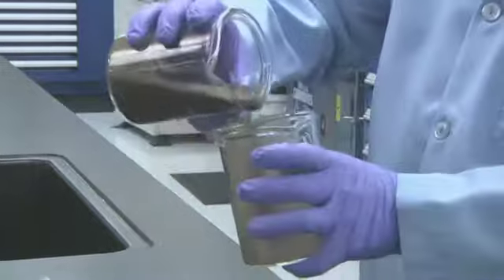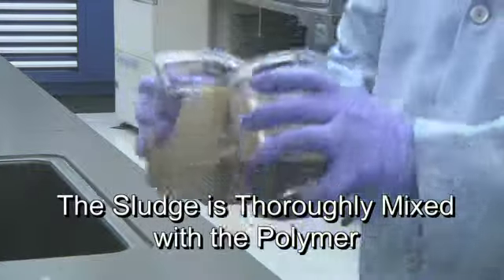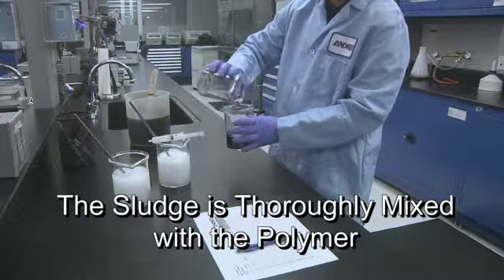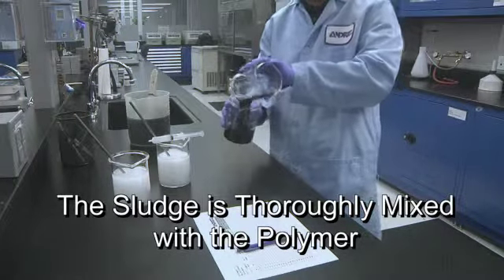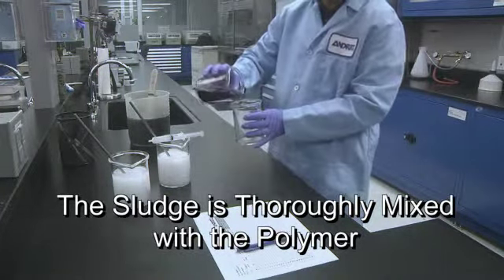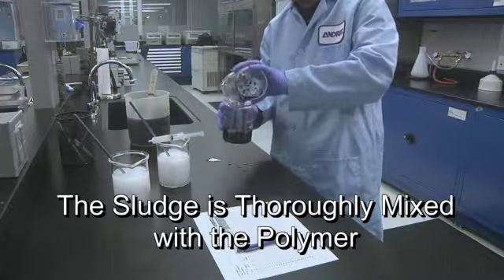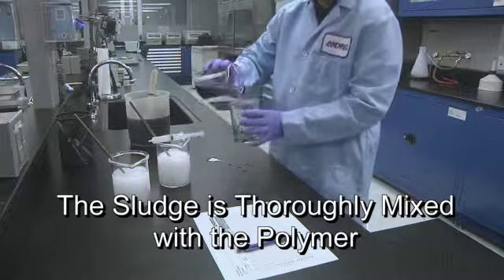The amount of mixing needed to reach optimum conditioning varies with different polymers and sludge concentrations. Sometimes, in order to maintain optimum conditioning, you will have to vary the amount of mixing with the polymer dosage.